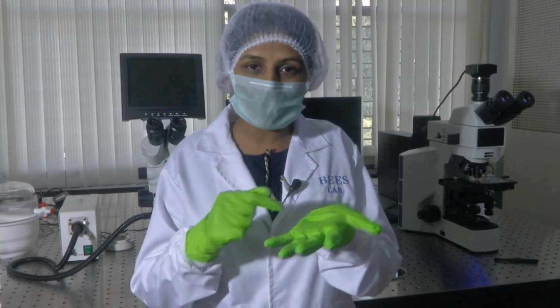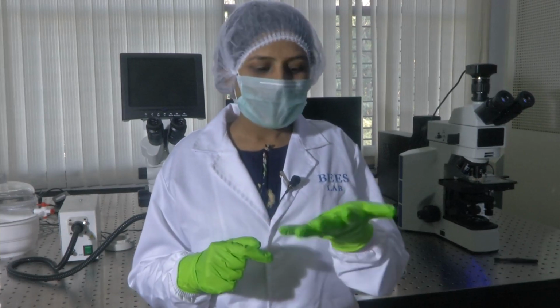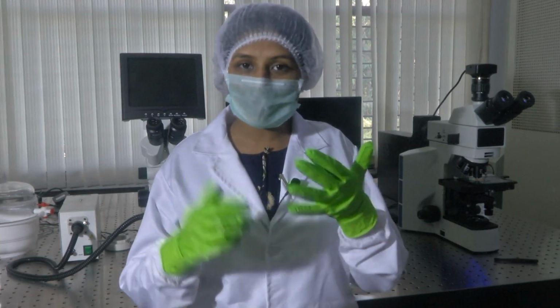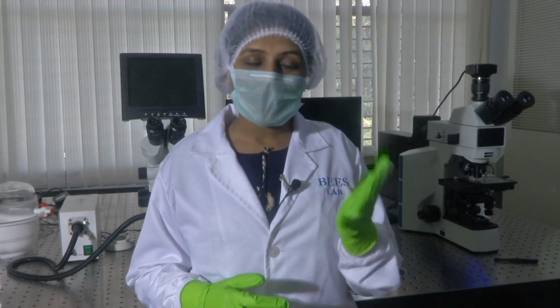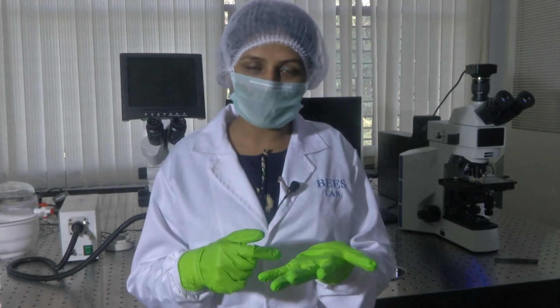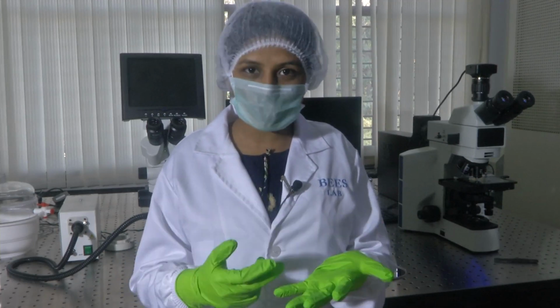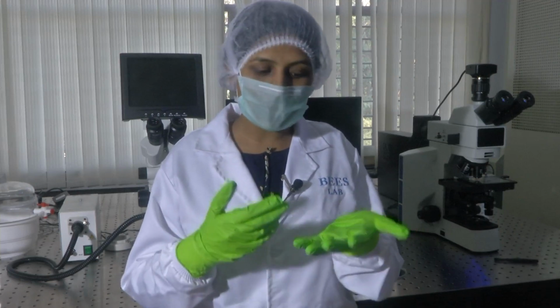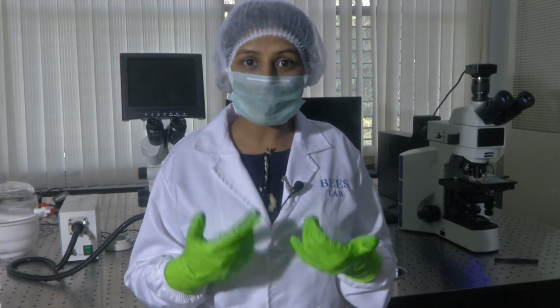microsensors, which are fabricated on silicon wafers. They are not visible to the naked eye. I am sure the fabrication technique and how these sensors look has been shown to you by Professor Hardik. So now, how do you see them? Once you've performed the fabrication, how do you understand if the features which have been engraved on your wafer comply with your design or your requirements?